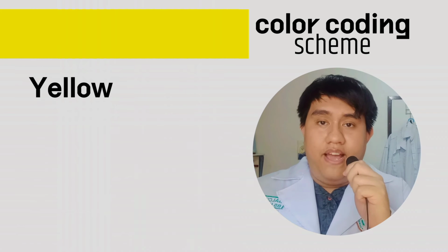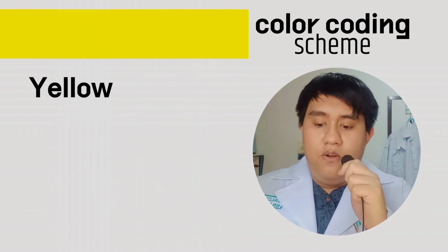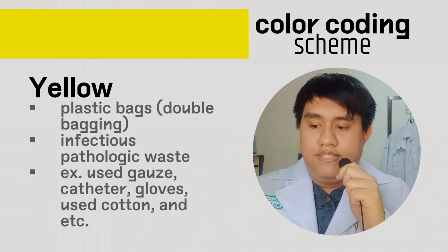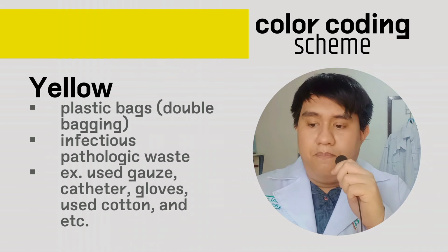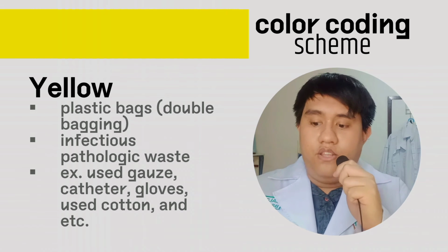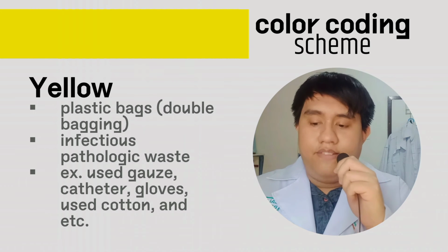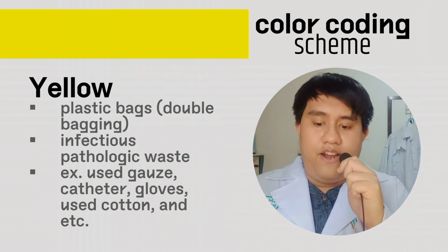The third one, we have the yellow bag. The yellow bag represents infectious waste. That's why it has a plastic bag type of container, and we usually do the double bagging. It has an infectious, pathologic type of waste, so we need to be careful.